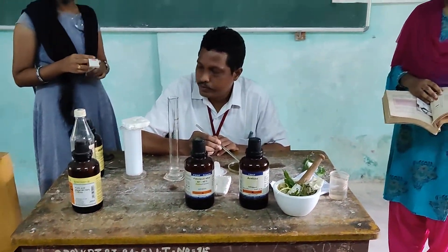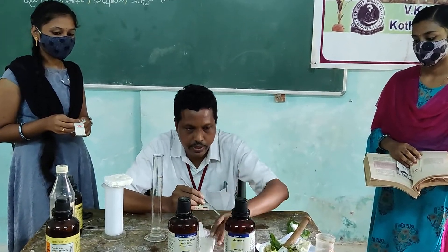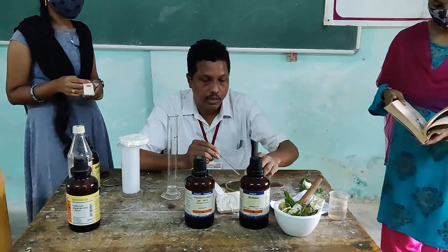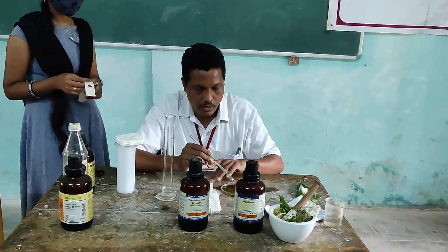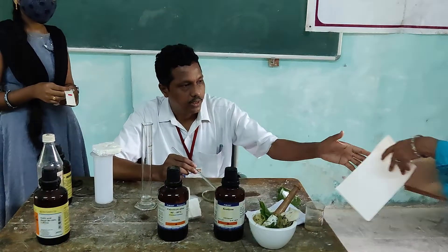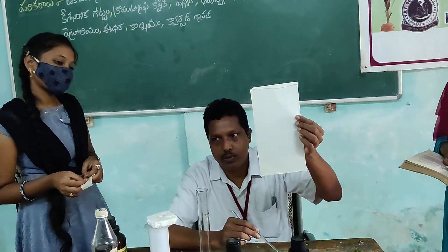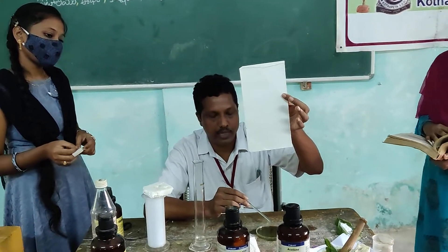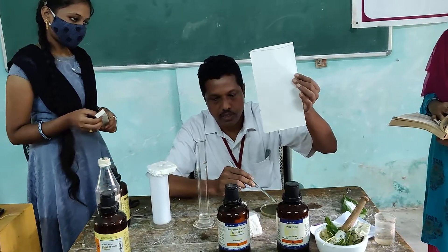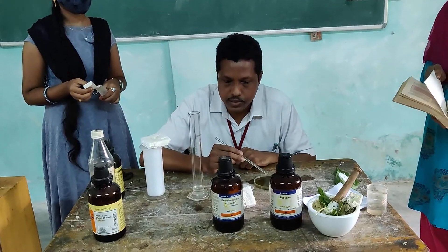Whatman No. 1 filter paper is used. When you prepare the chromatography paper, Whatman No. 1 paper is used throughout the process. The paper is cut to the appropriate column size.